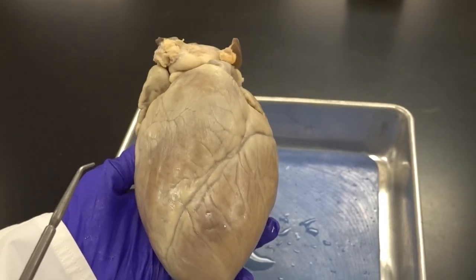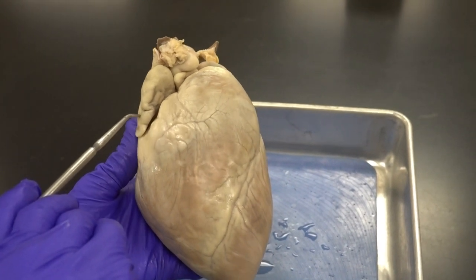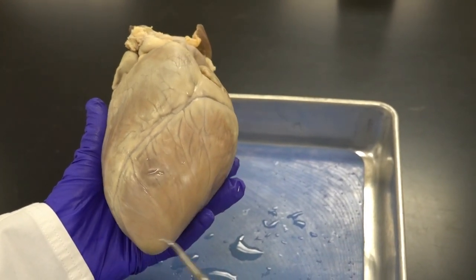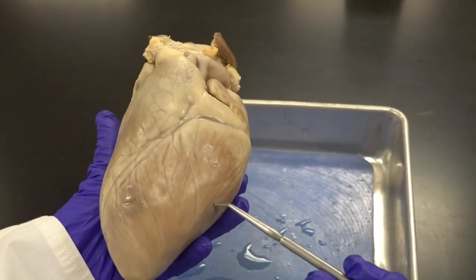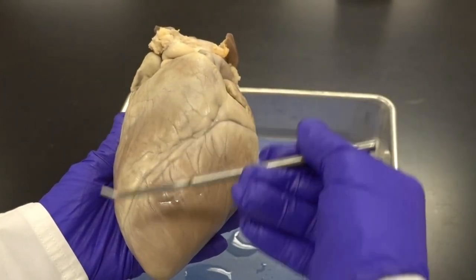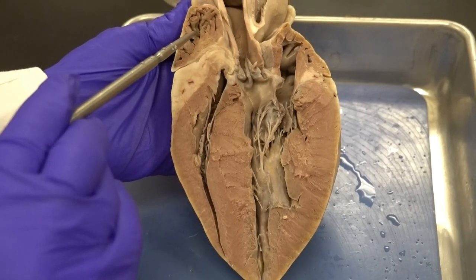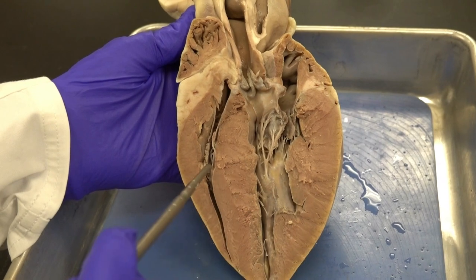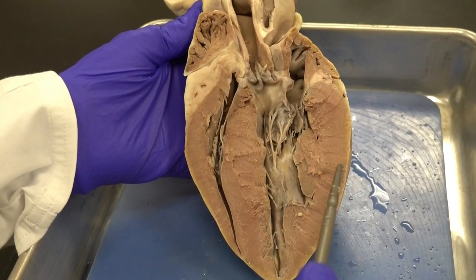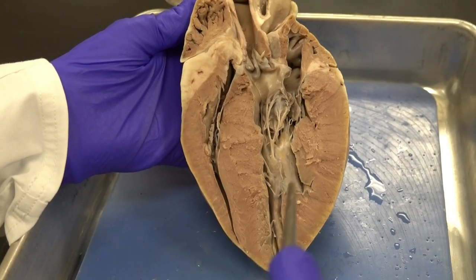Now I dissect the heart through the coronal (frontal) plane. I start at one atrium — for example the right atrium — cut all the way down toward the apex through both the atrial and ventricular walls, continue on the other side, and also cut the interventricular septum to completely open the heart. In this coronal section I can identify the right and left atria and the right and left ventricles. The left ventricle is identified by its notably thicker wall compared to the right ventricle.